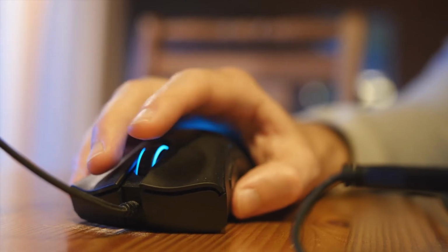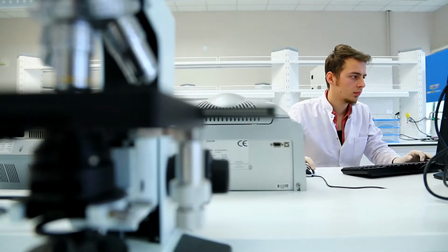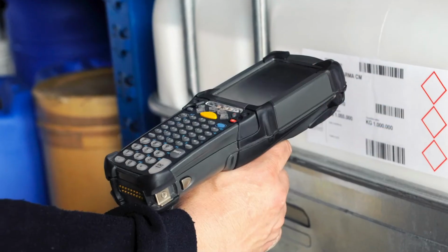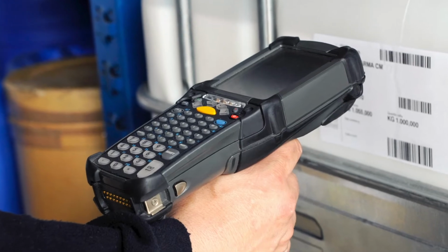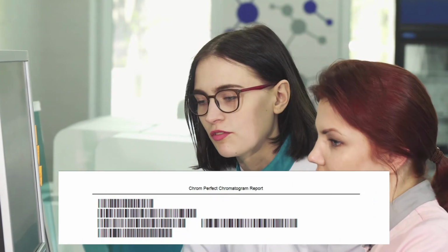This is especially true when users must manually type complex data and text strings, a common requirement for chromatography analysis. An exciting new feature with Chromperfect version 8.2 is the ability to embed barcodes directly in the report header. This means that you can significantly increase the efficiency of your laboratory admin team and eliminate human error. The new feature uses the open-source barcode font Code 128.